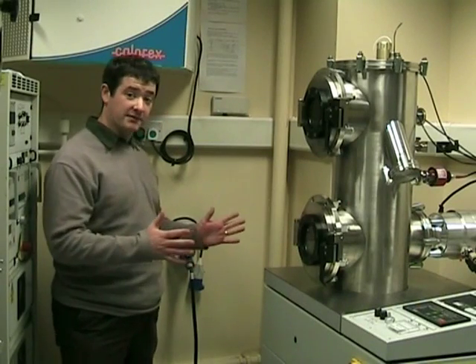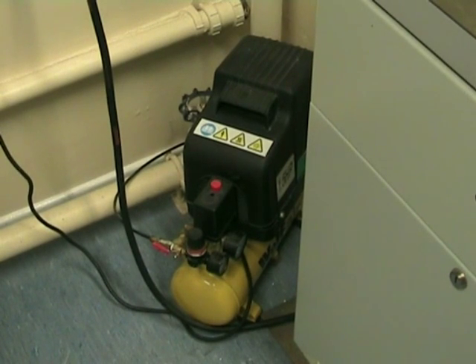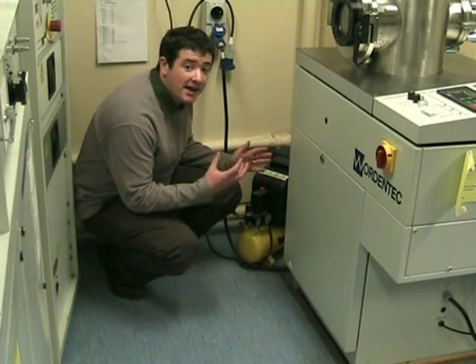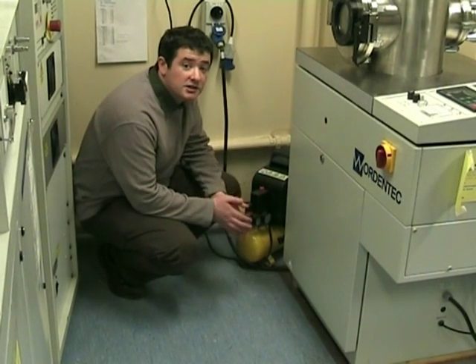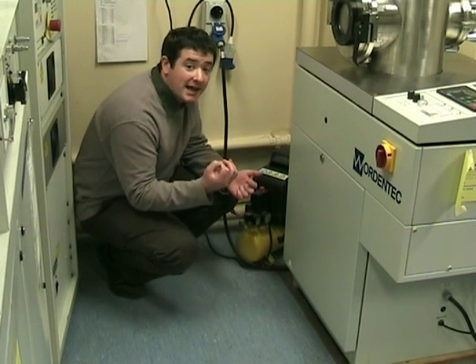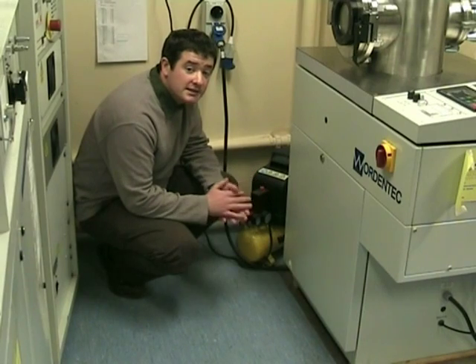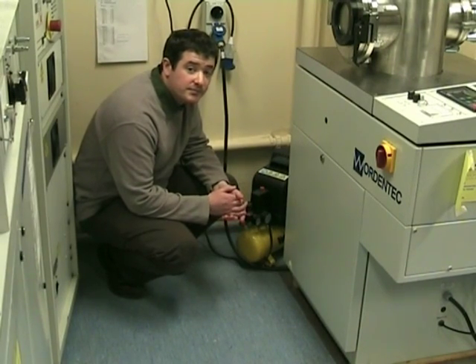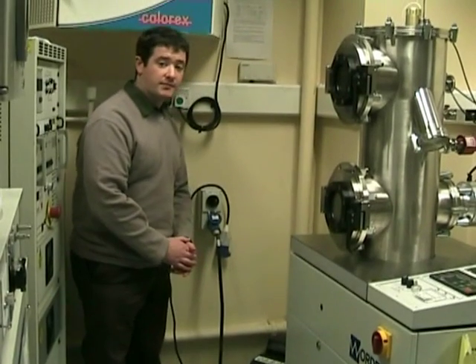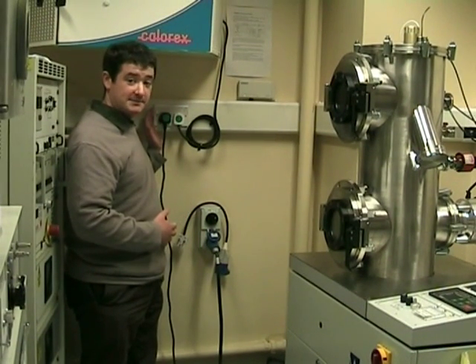At the back of the evaporator, we have the compressor. The compressor compresses the air, which powers the shutter above the crucible. It also supplies air to slow down the turbo pump when it's turning off. At the back, we have the on switch to the compressor.